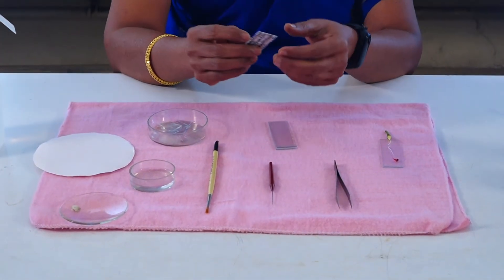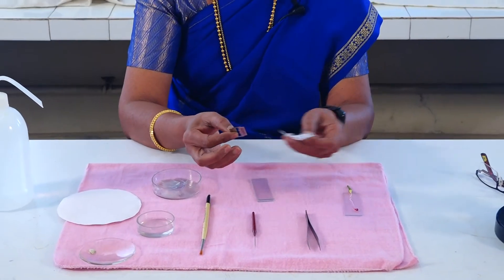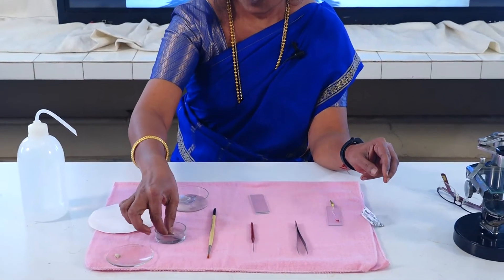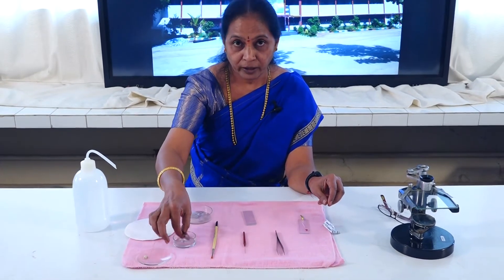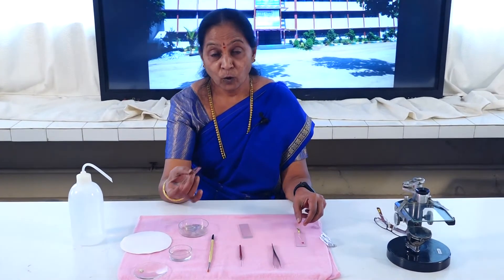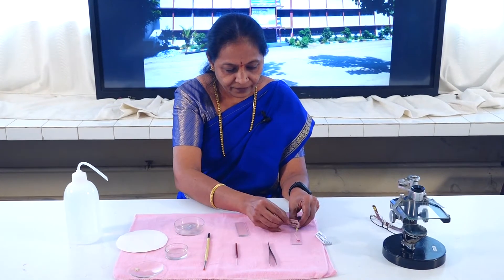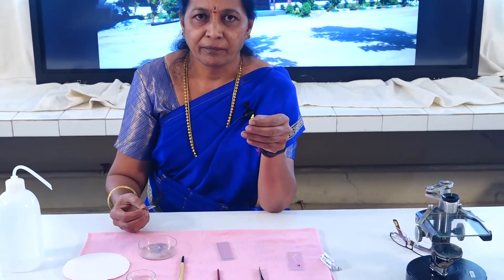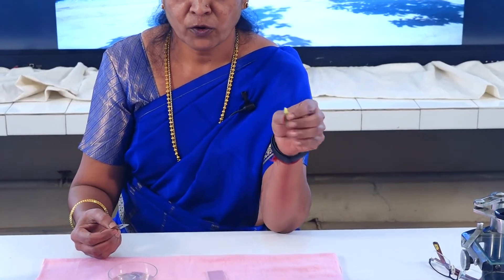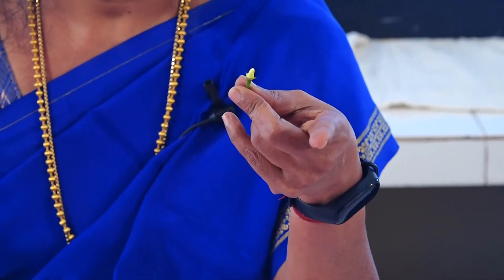Now I am going to take the section of the TS of ovary. A new blade is very important. Hold the blade — first dip the blade in water and hold it in your right hand, and the ovary in your left hand. Hold the ovary between these two fingers: the thumb and the index finger.